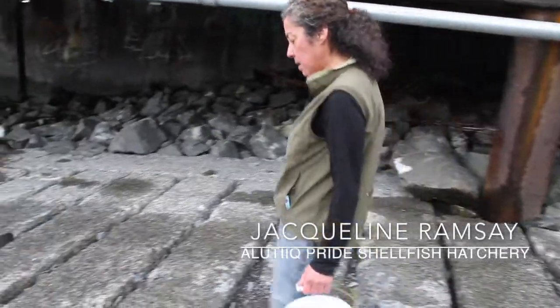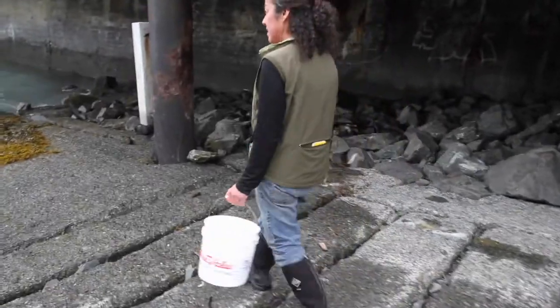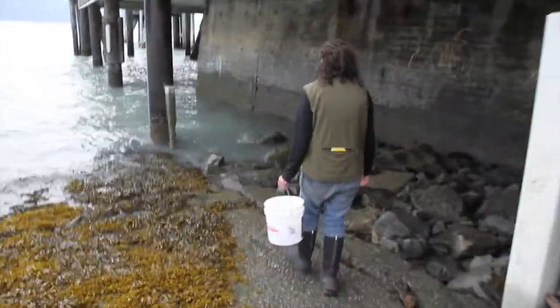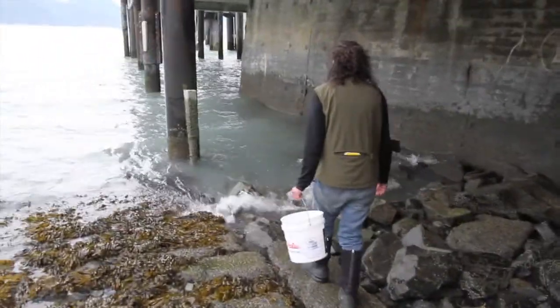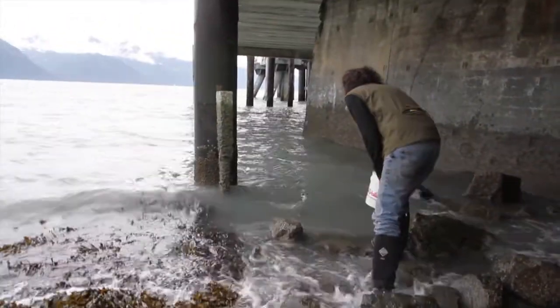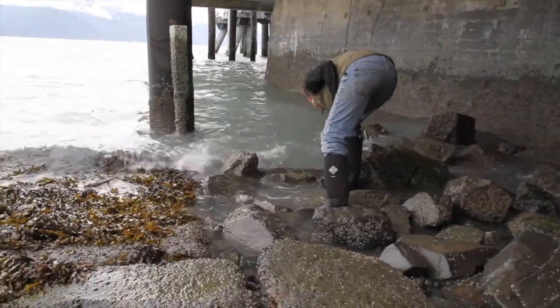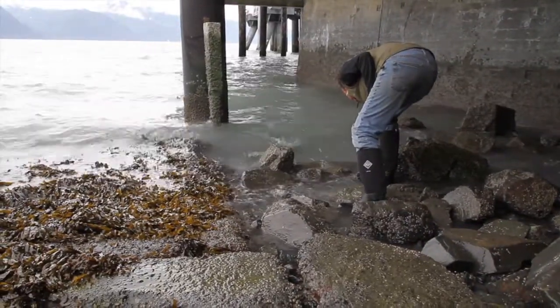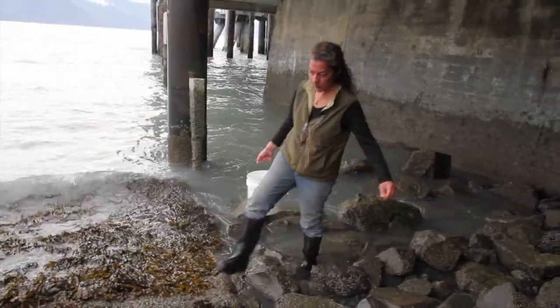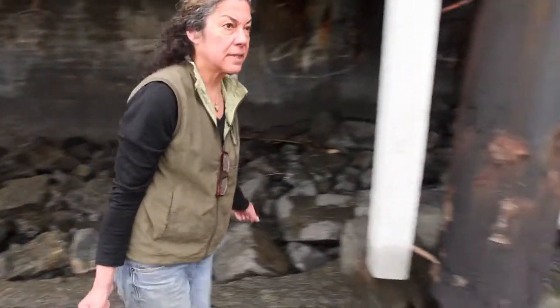I'm going to go down and grab a bucket of water for our water sample today. It's seawater. The tide's coming up a little bit. So after I get my bucket, I'm going to take it up here to high tide.